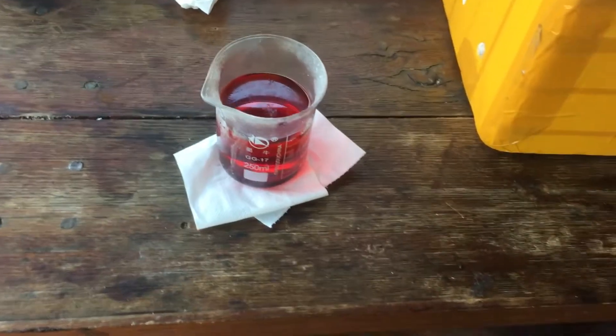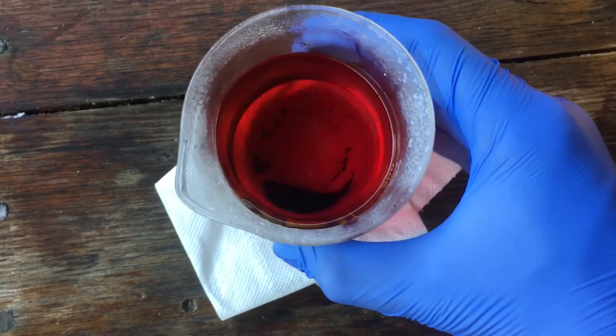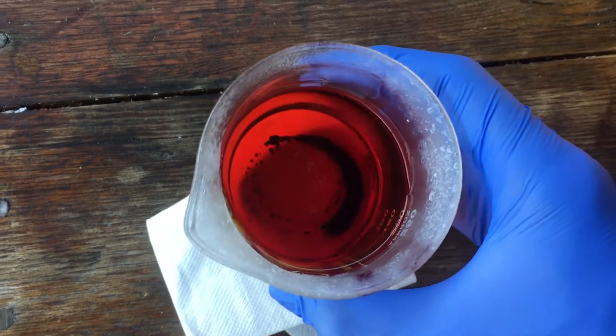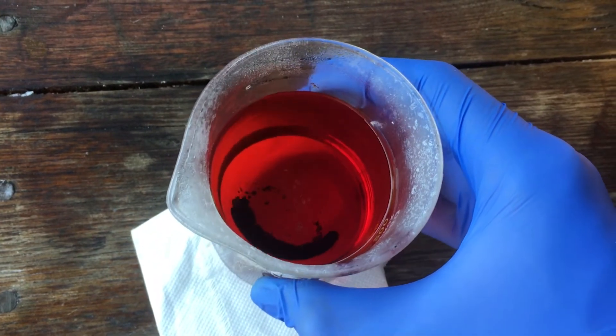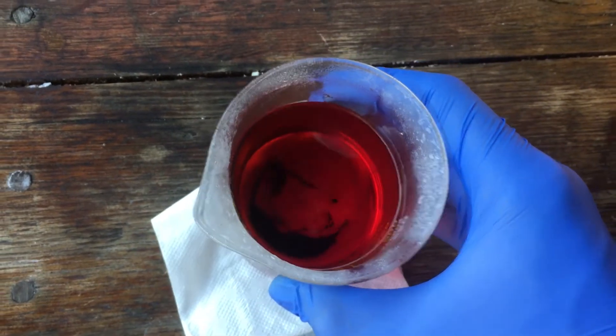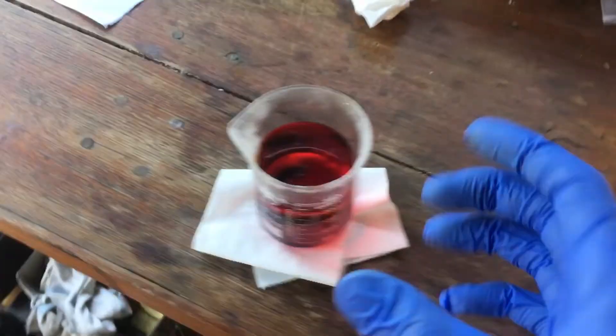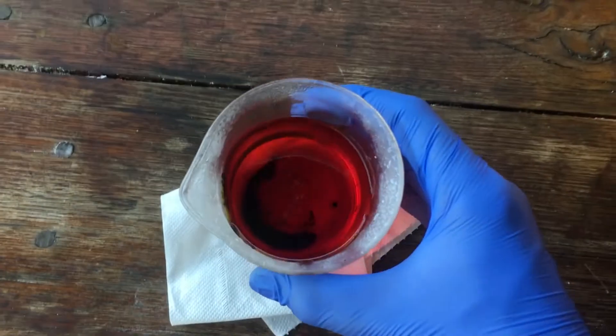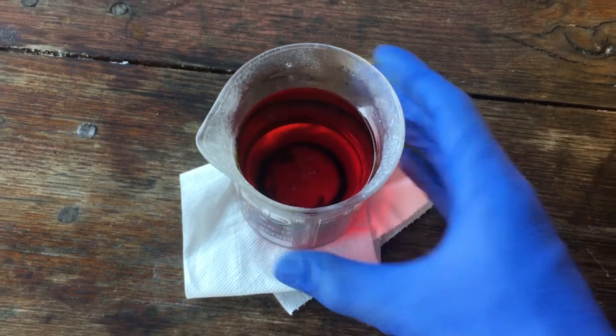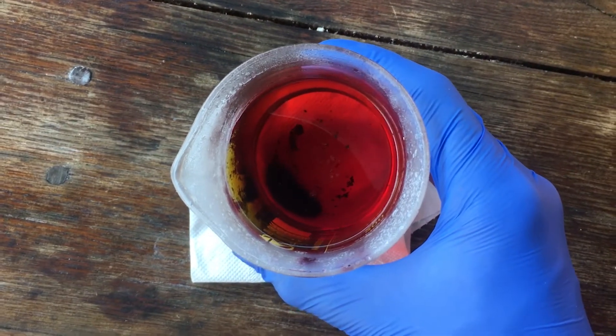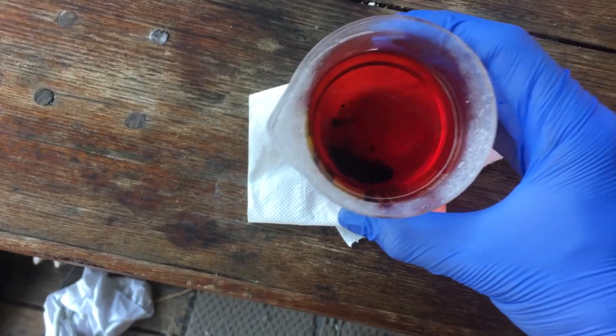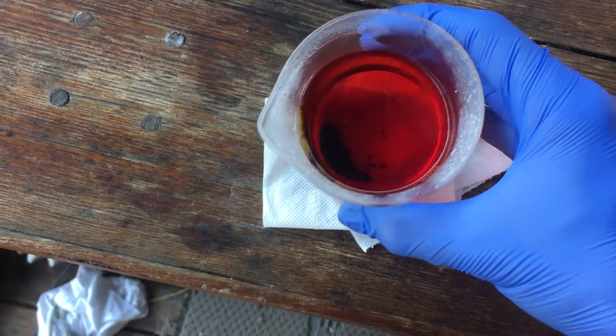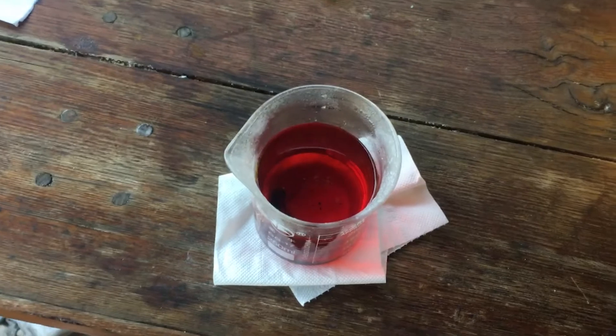So I'll open this up and just take out the electrodes and show you that we do actually have bromine in the bottom. You can see we've got a whole bunch of kind of red staining around the box, but that's to be expected. We are working with bromine. I've gone ahead and taken the cell out just to show you that down the bottom we have running around a whole bunch of elemental bromine, which has formed just in the last couple of hours since I turned the current up. Clearly a kind of high current density for the electrodes for this synthesis is actually essential for the production of elemental bromine. Well, I'm very happy this has worked. Might even be a few milliliters of bromine. Finally, something new we do on this channel has actually worked. Something that's never been done on YouTube before.